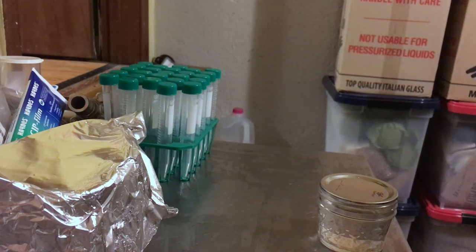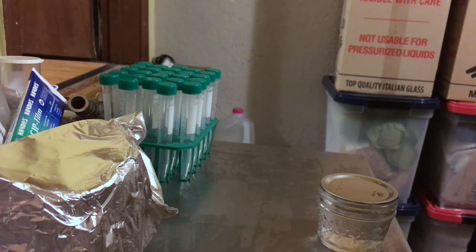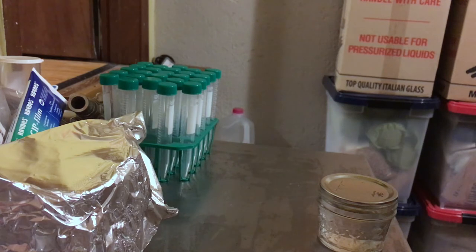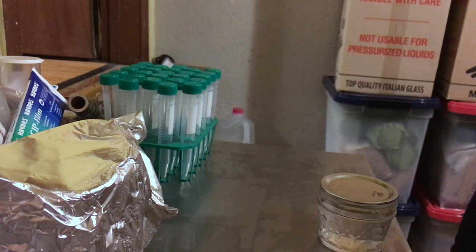Third attempt at doing this. I did a full 25 vials with some Pac-Man yeast, which is rapidly becoming my favorite strain for neutral ales. I have 25 vials. I bought these same tubes and froze them all.